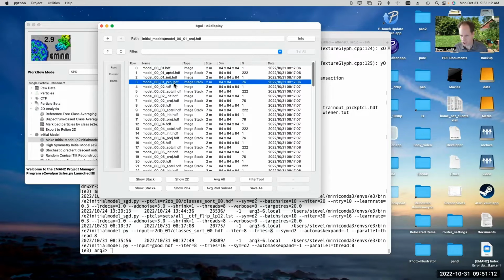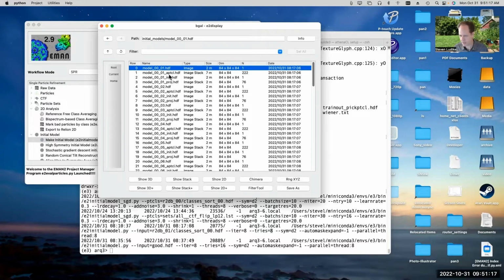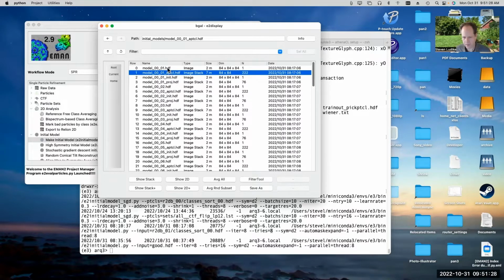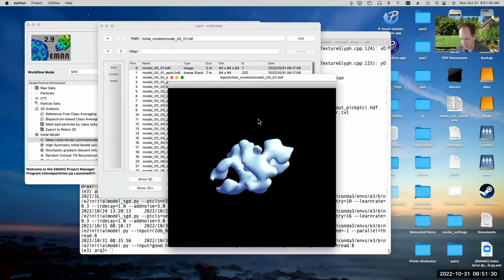And then it has a projections file, which shows you projections of this in all different orientations. Now you can generate this sort of on the fly using other programs available in the system. But it's just there for convenience, basically. All right, so let's take a look at the model that we got, and we can see what it looks like.